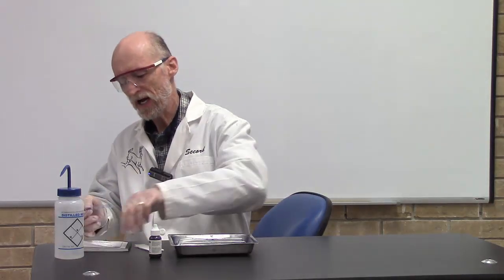And there I have it. I have a properly prepared simple stain. Now let me show you a close-up of what your slide should look like when it's complete.